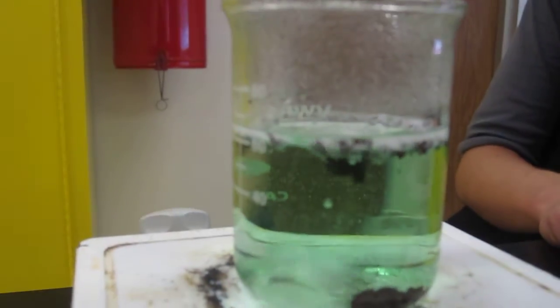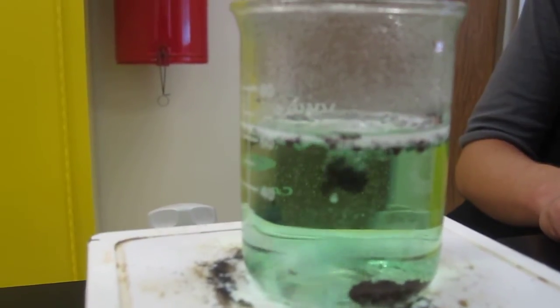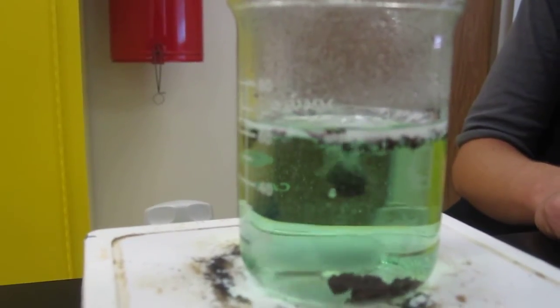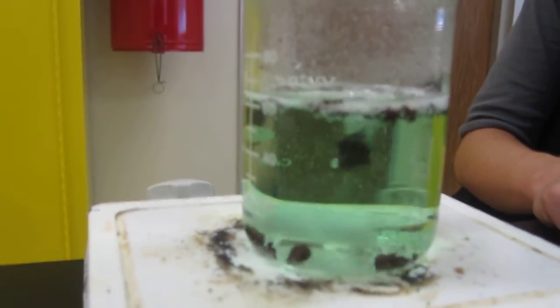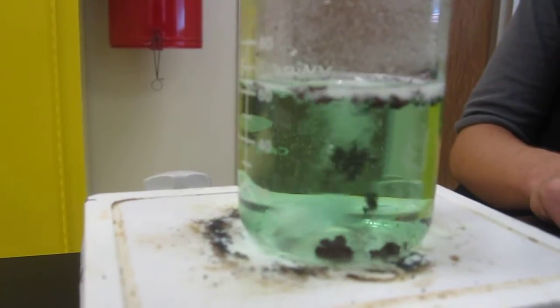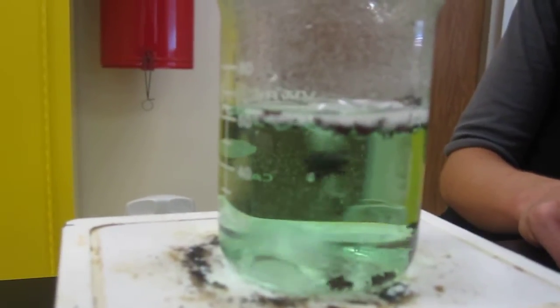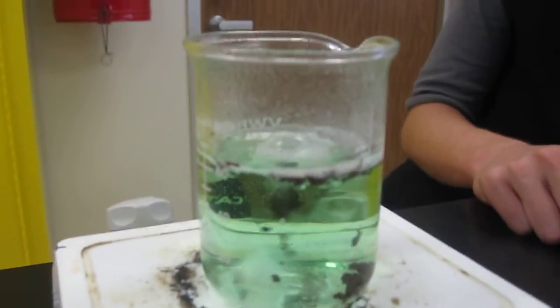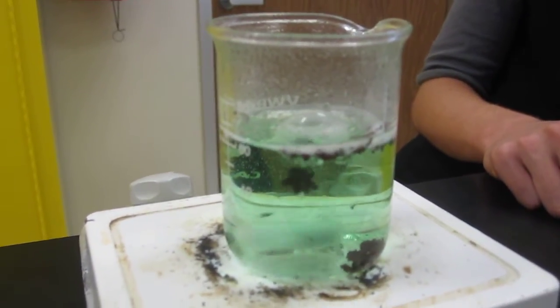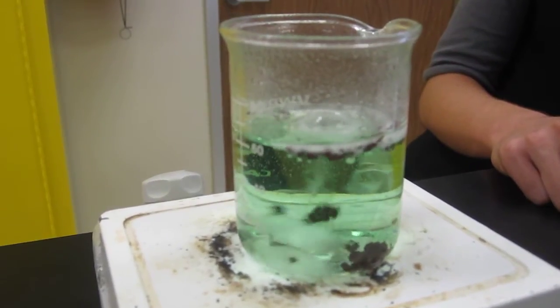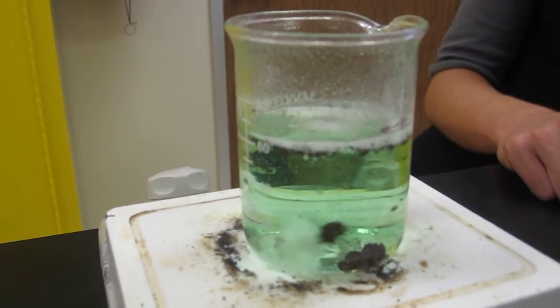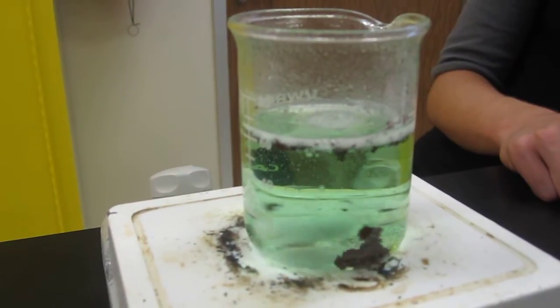So I'm not going to stick around for that because it will probably be five minutes and I don't have enough to say. The one thing I do want to talk about is that this is a single displacement reaction. So I guess try to figure out what the reaction equation is. Well, if it were a known copper compound, I guess you guys don't know what copper compound you've got, so not yet.